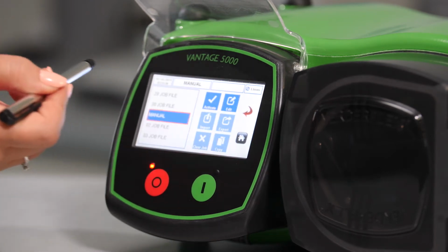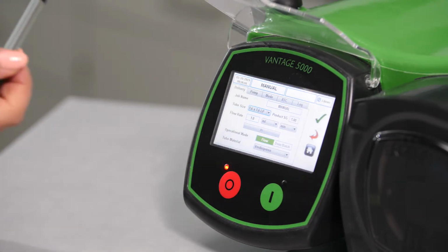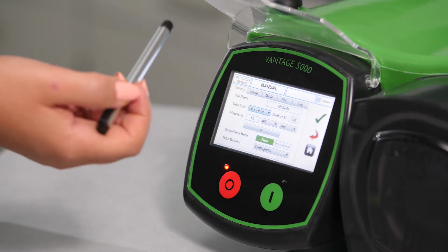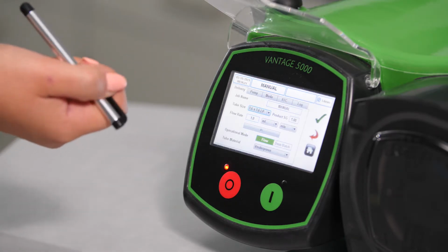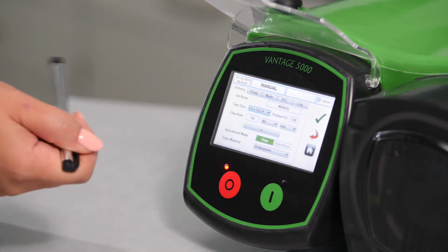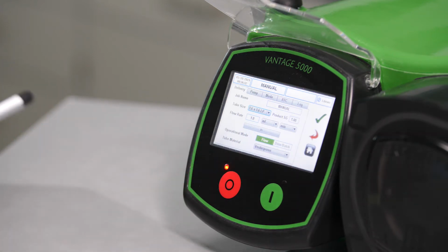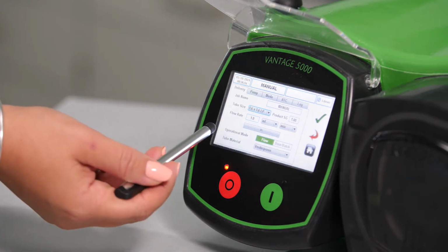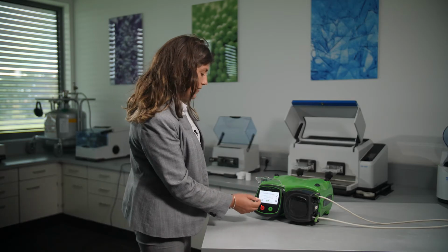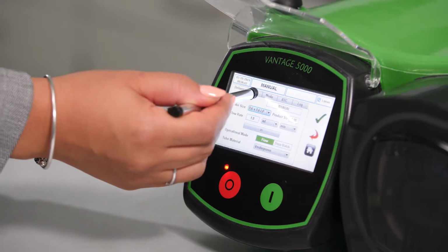To start with, we're going to select Edit Job File, and here we have 5 different tabs, which are Delivery, Pump, Mode, Real-Time Clock and Log. In the Delivery tab, we can see job name, tube size, flow rate, operational mode, which is flow or batch and dose mode, and also we can see tube material.